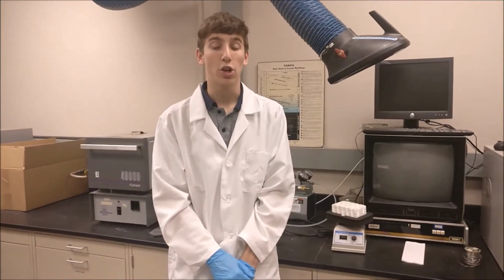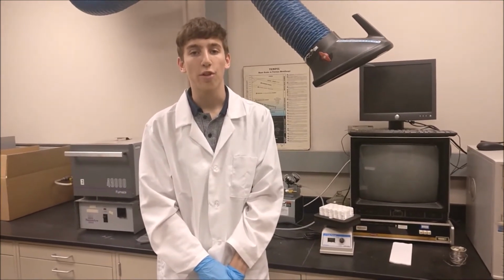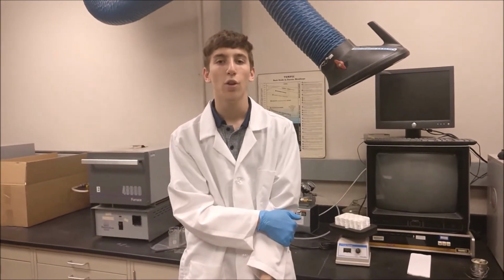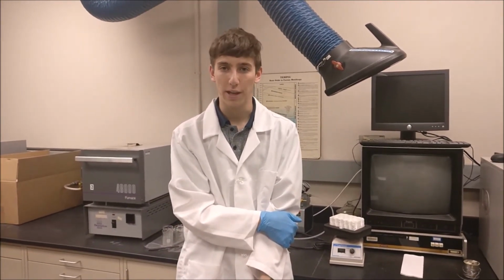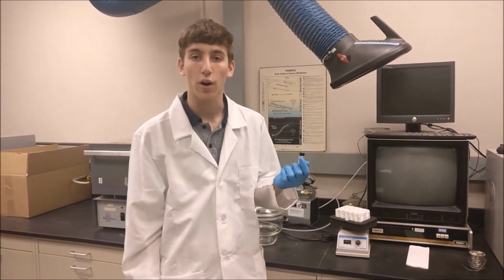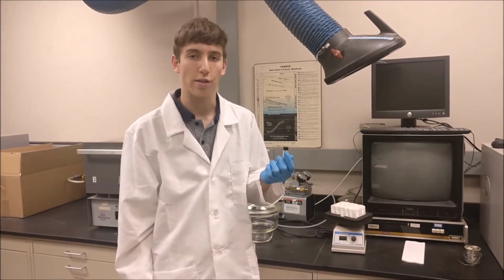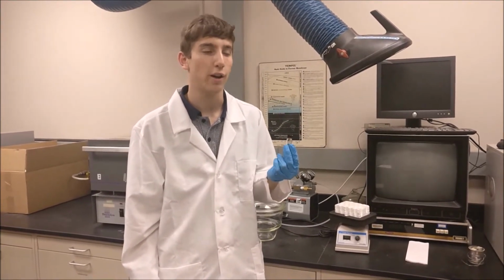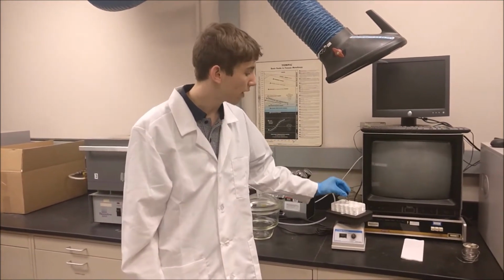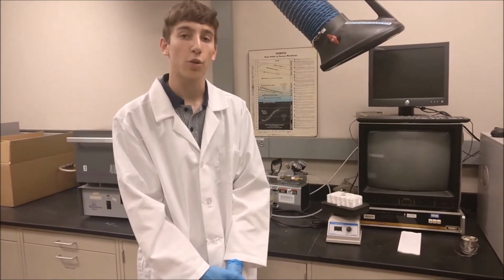Hi, I'm going to show you how to prepare our thin film samples by spin coating. Before spin coating, the solutions first have to be synthesized. For our experiment, we dissolved crushed polystyrene beads into our solvent, toluene. We made varying concentrations from 50 to 140 milligrams per milliliter. The reason we made these varying concentrations was to study the effect of concentration on final film thickness. After making our solutions, we used a vortex mixer to increase the homogeneity and increase the rate of dissolution.